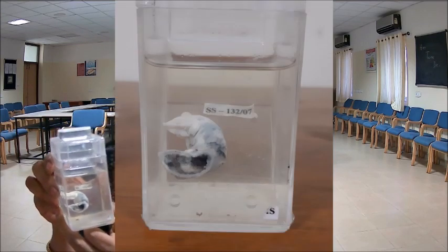This is another specimen. This is very well made out. You can make it out when we look at the tissue grossly, and for studying we take a section from the tip of the appendix like this. Okay, lumen is patent. Lumen is not obstructed.